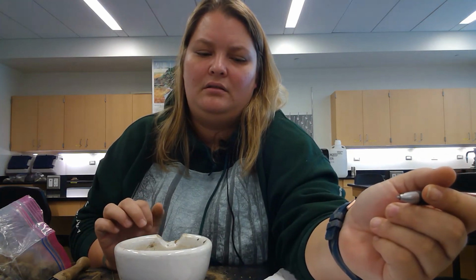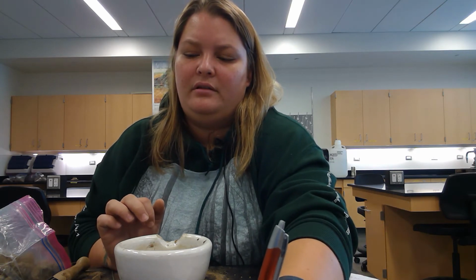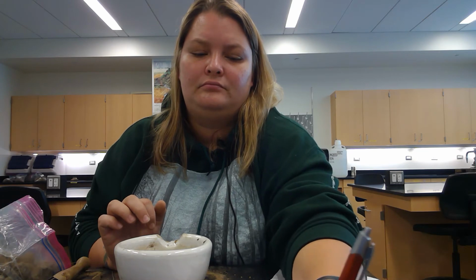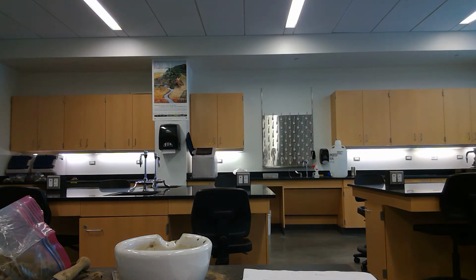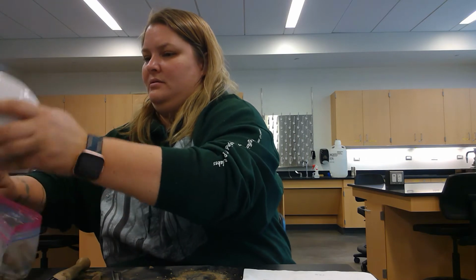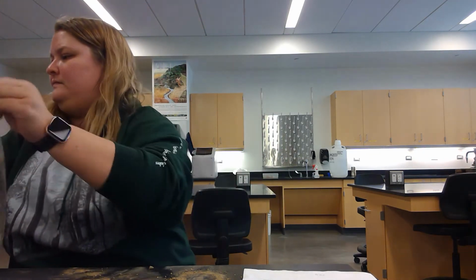All right, and this one is 134.01 grams. Then put that on a piece of wax paper.